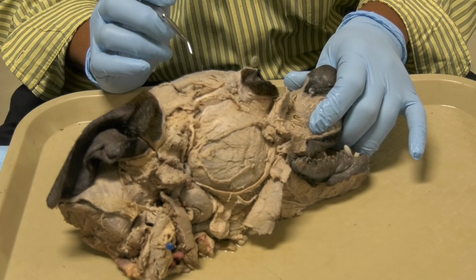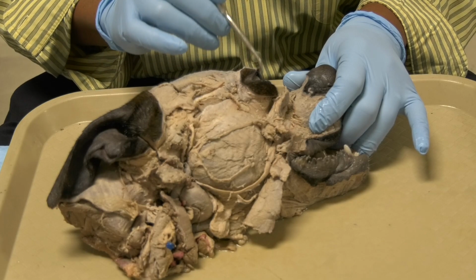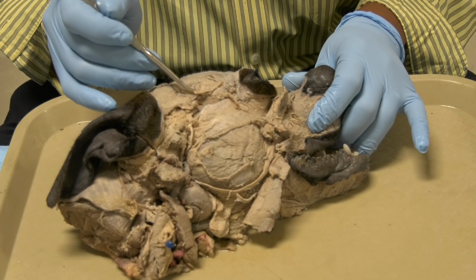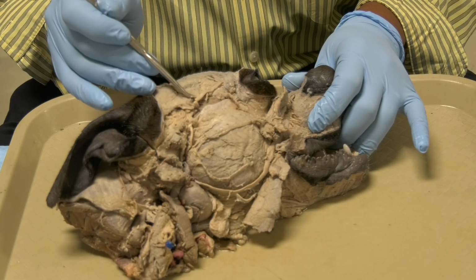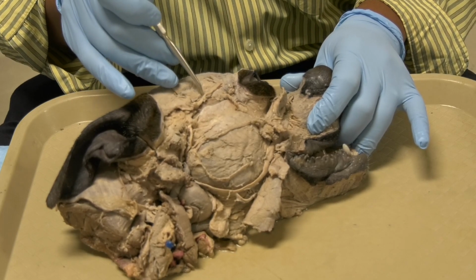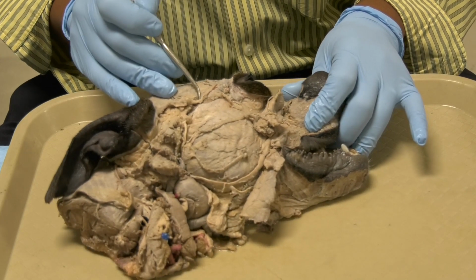We call that blepharospasm. So when you come to examine the eye, you need to block the palpebral branch of the auriculopalpebral. It is being cut here, but this is a continuation of it. This is the palpebral branch, and when you come to block it, you have to block it at this level here. This is the tip of the zygomatic arch.